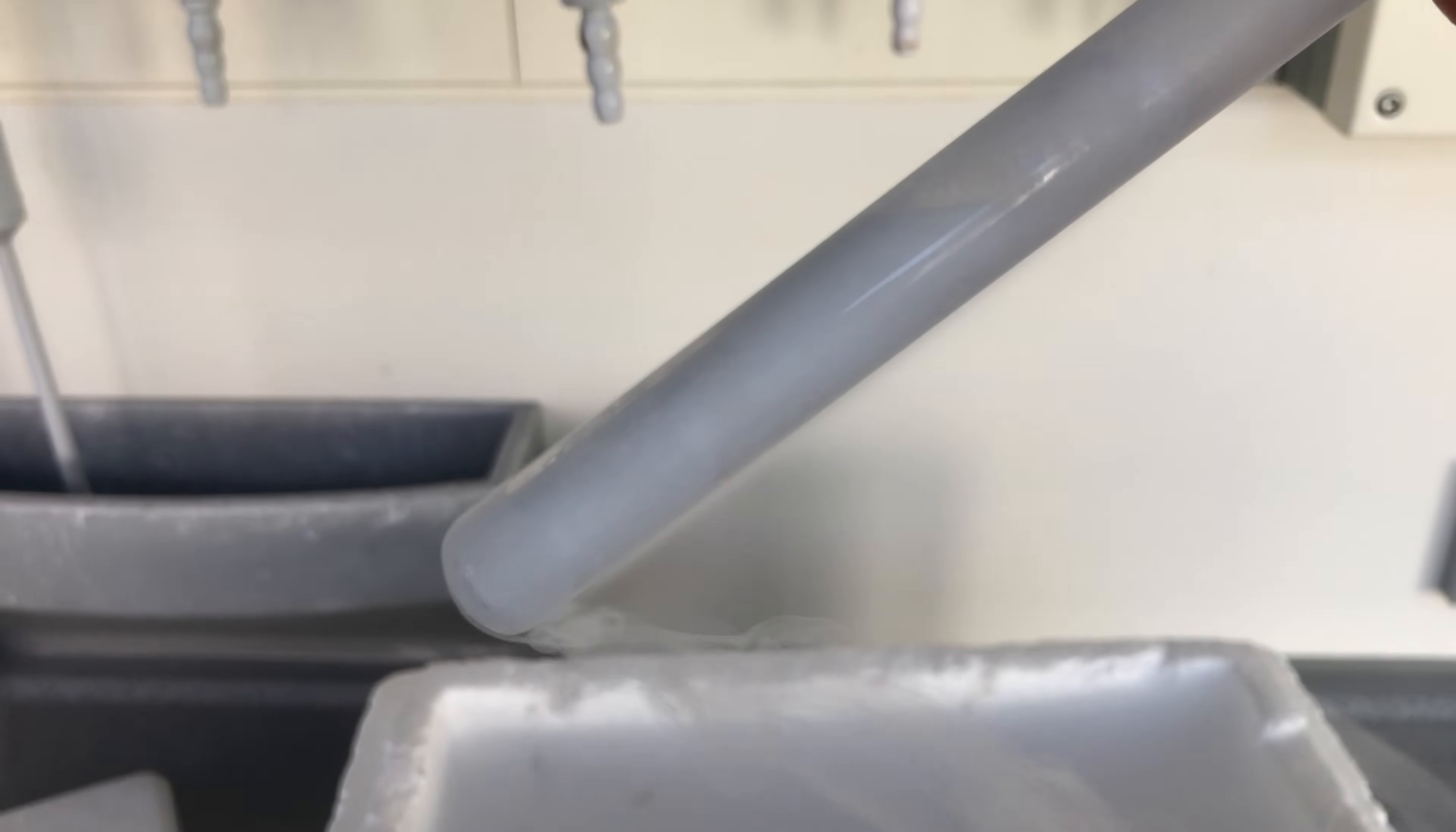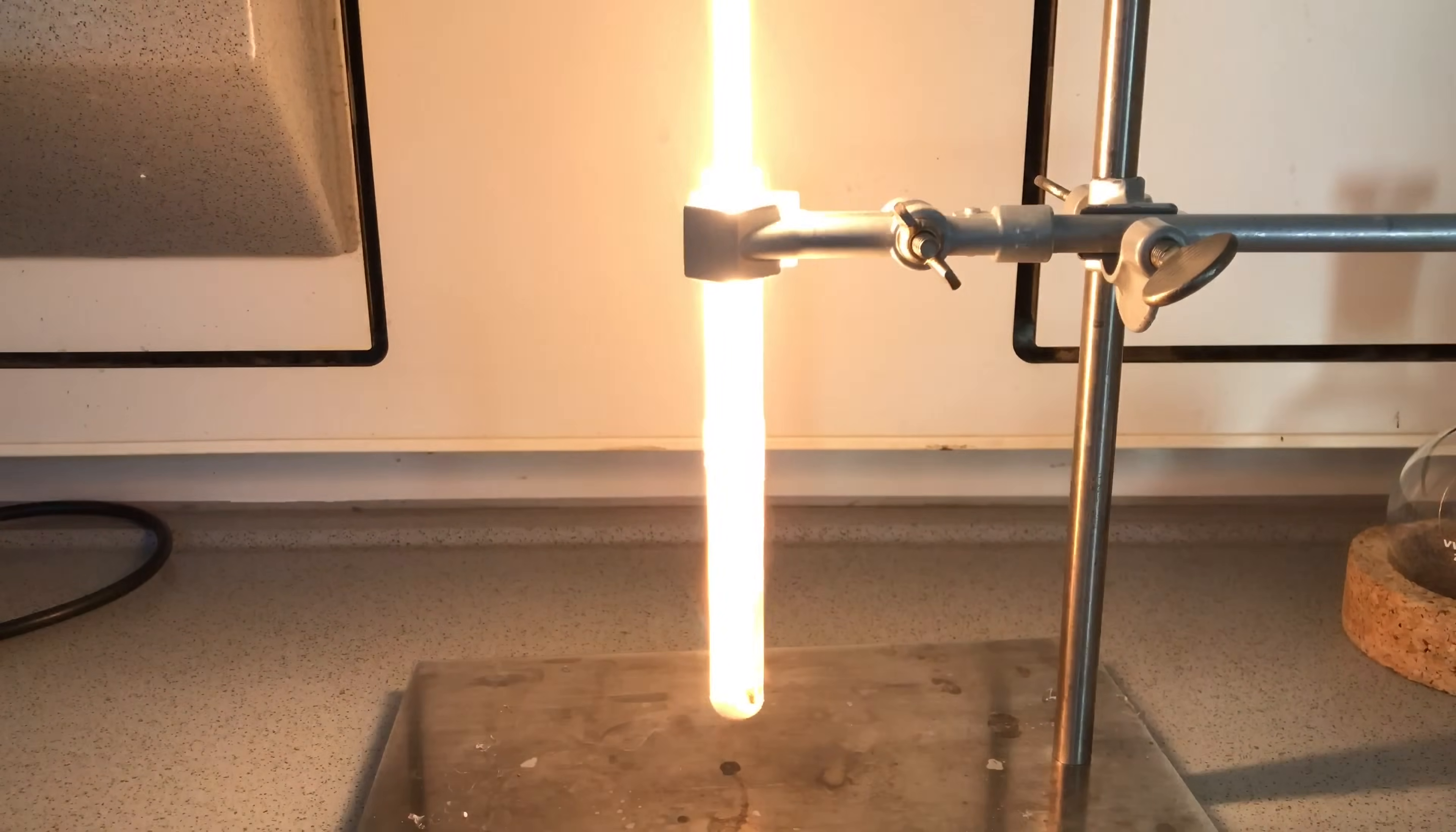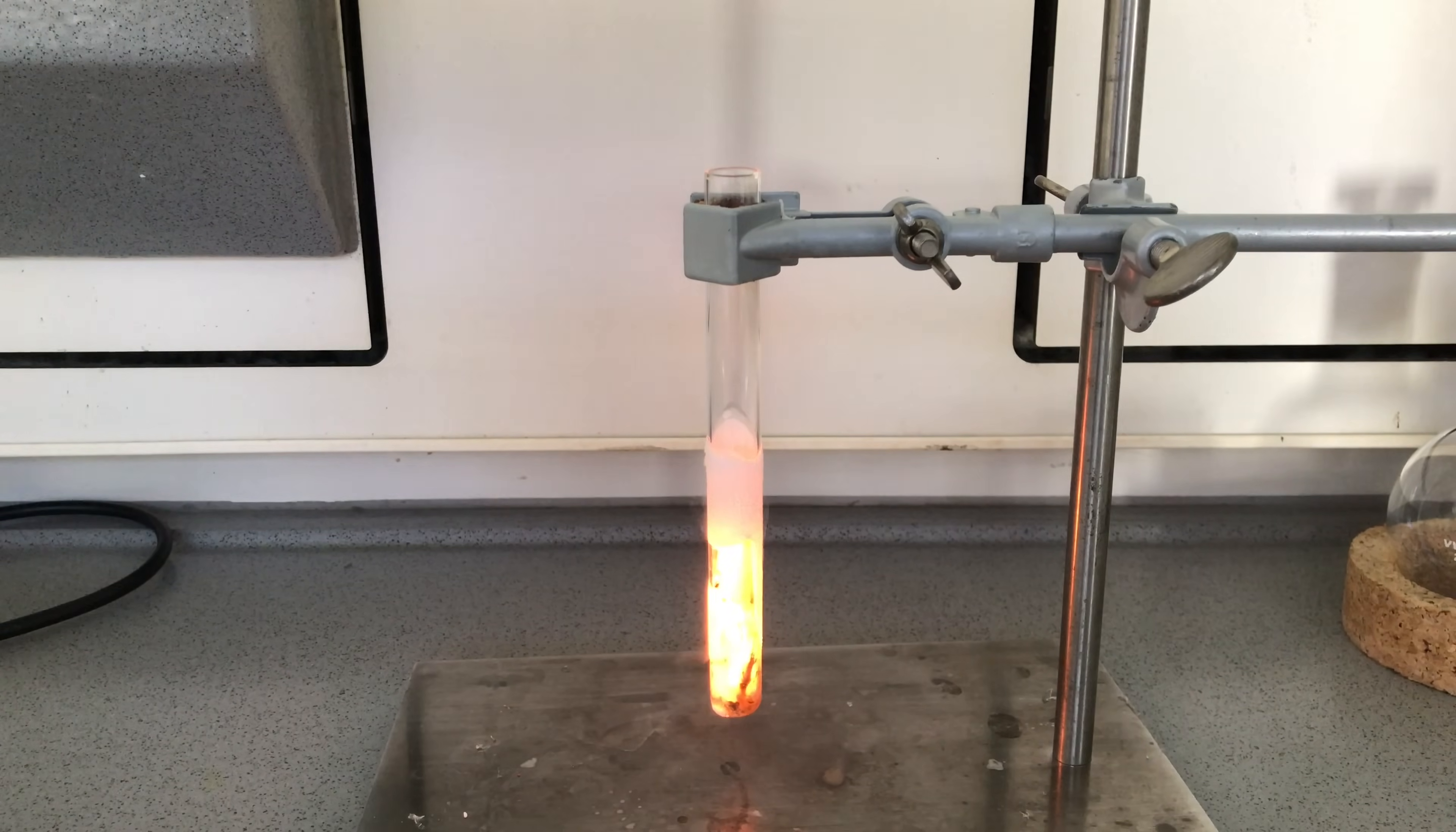It's a white substance. We threw in some matches and the first two went out. If this was liquid oxygen, it would have caught on fire immediately. With the third match it finally ignited and we got this nice reaction. It was much less aggressive than anticipated.